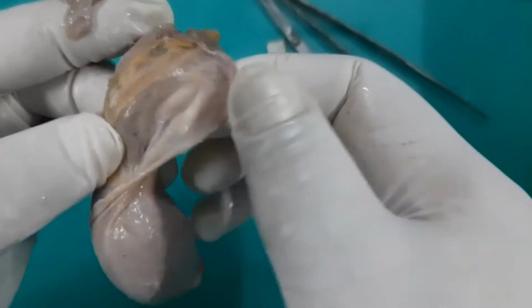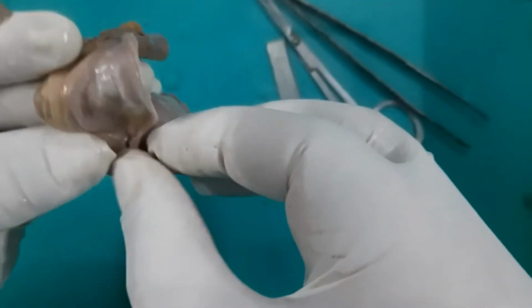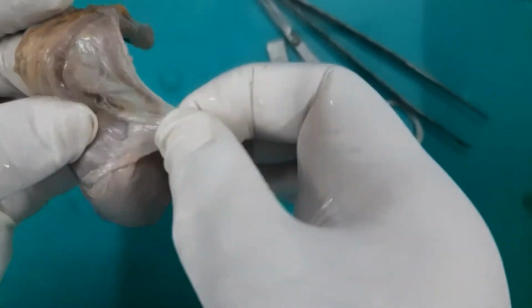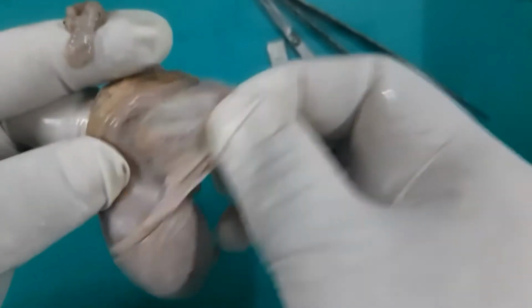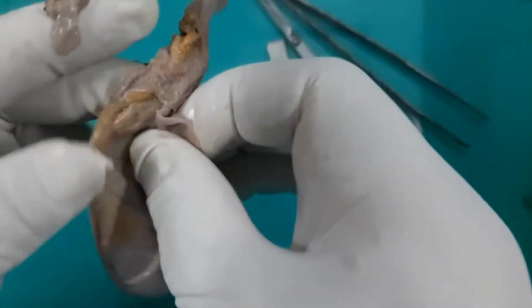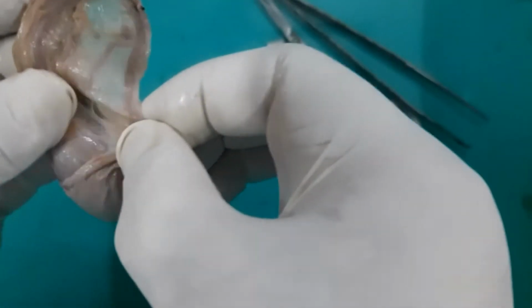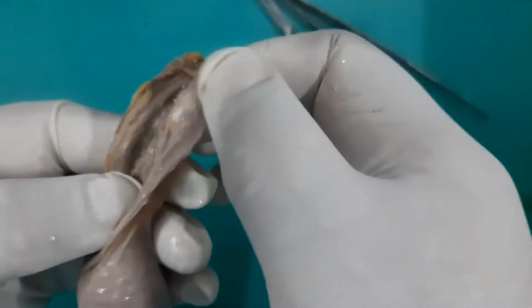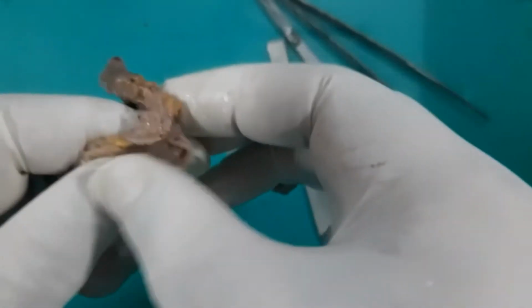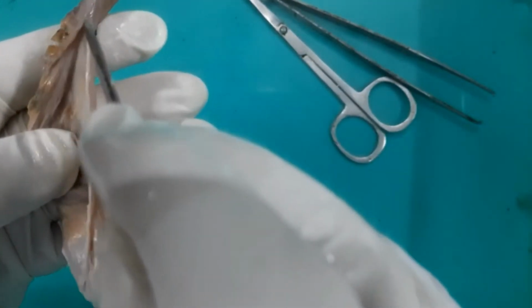be the internal spermatic fascia, a very thin layer which is the continuation, or prolongation, of the fascia transversalis. I am just removing the cremasteric muscle and its fascia from the spermatic cord and trying to trace its continuity onto the testes. So I am successful in removing most of this cremasteric muscle and its fascia.